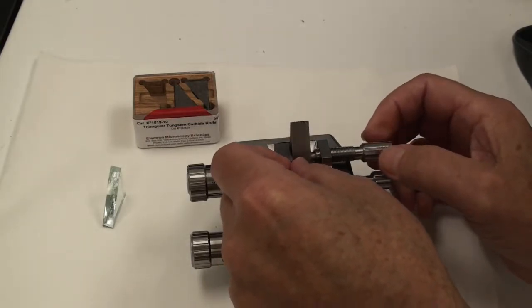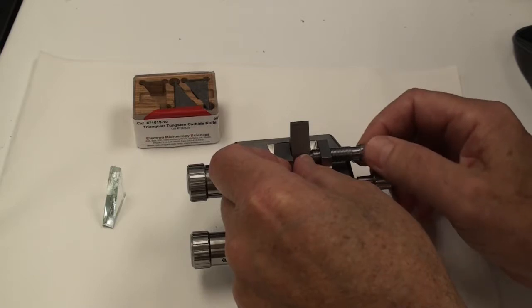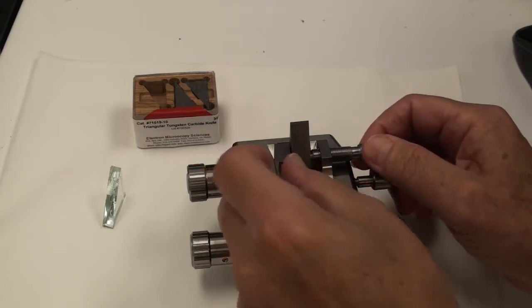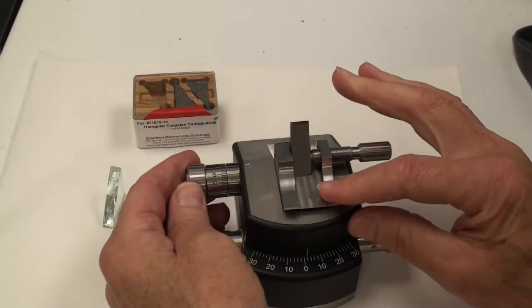So this loads just like a regular glass or diamond knife. We're going to put it in there. This knife does ask for a 10 degree clearance angle, so we're going to set that, and that's a little bit higher.